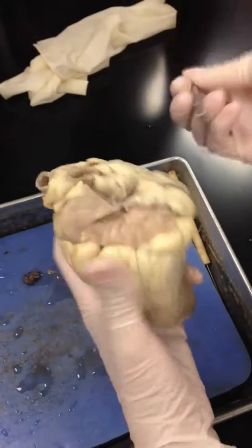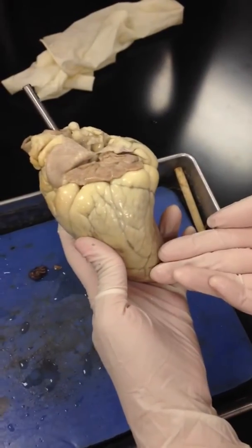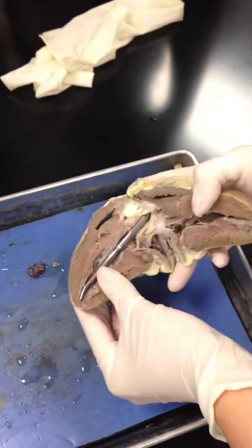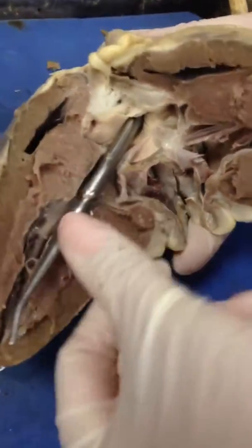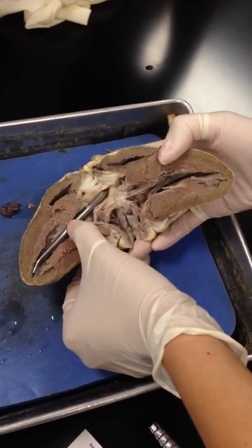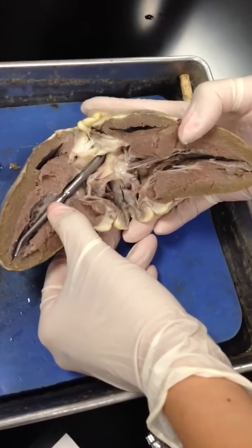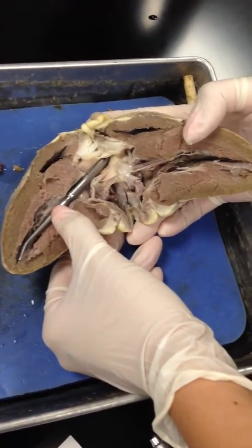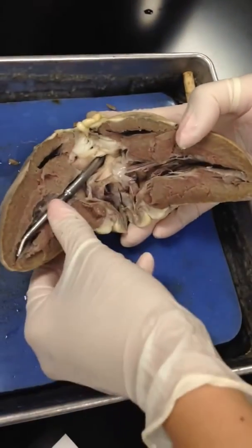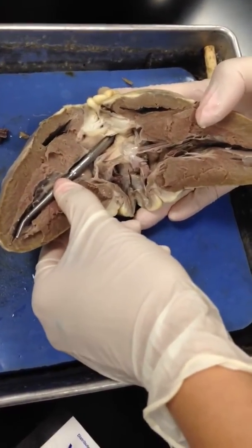Now the next obvious one would be the aorta. If this is the aorta, where would the blood be coming from? Left ventricle. Left ventricle. Is it? It is. So it's coming from the left ventricle. So what chamber is this? Left ventricle. Is this oxygenated or deoxygenated blood? Oxygenated. Good. What vessel is this? Aorta — because the blood is coming from the left ventricle shooting out through that specific vessel. Now what valve is it going through? Aortic semilunar valve. Good. And on that side we have the bicuspid valve.